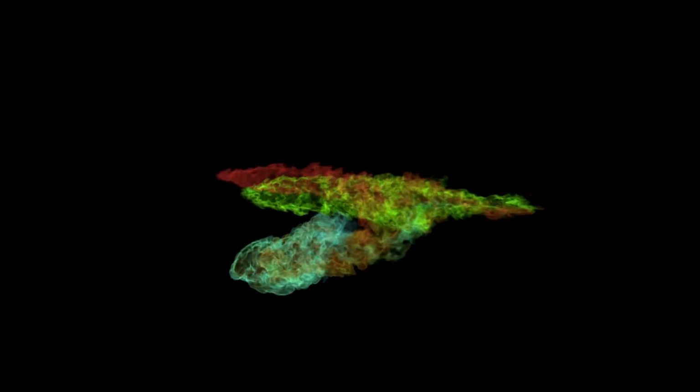In this clip there, spraying four different mixtures at once. One in each hand, and there's two of them.